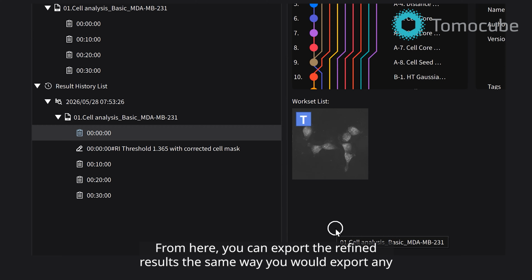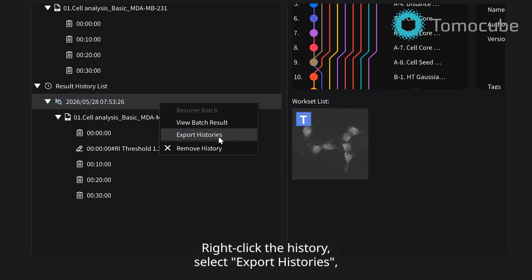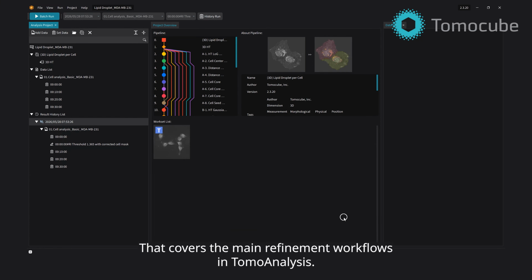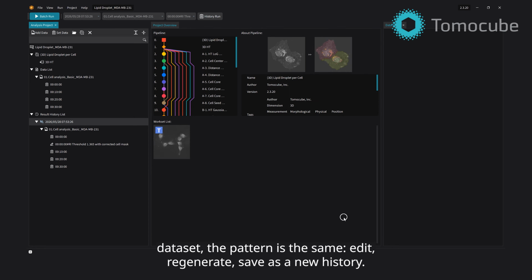From here, you can export the refined results the same way you would export any other history. Right-click the history, select Export Histories, and follow the export process from the previous video. That covers the main refinement workflows in TomoAnalysis. Whether you're correcting a specific cell mask or adjusting parameters across the dataset, the pattern is the same. Edit, regenerate, save as a new history.